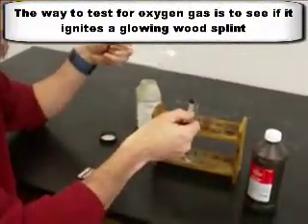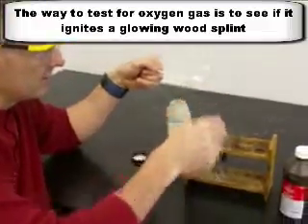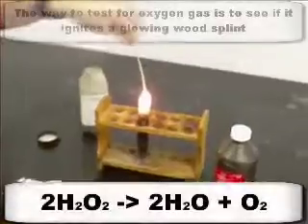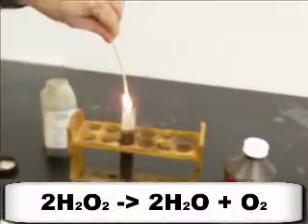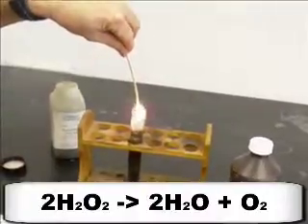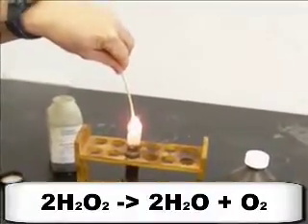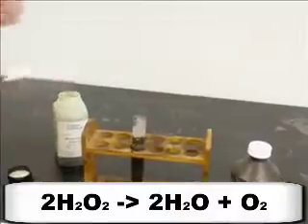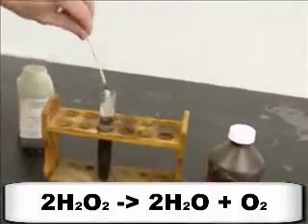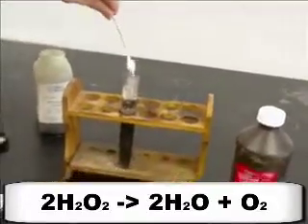So I'm going to add this. This should produce oxygen gas. And then watch what happens when I put this in here. See how it lights up much brighter? That's because we are producing O2 gas. See, it stays lit even when I put it in there because it's producing this oxygen gas. You can even blow it out and make it glow and put it in there, and it'll reignite. Hey, look at that. See how that's pretty cool? Because it's producing the oxygen gas.